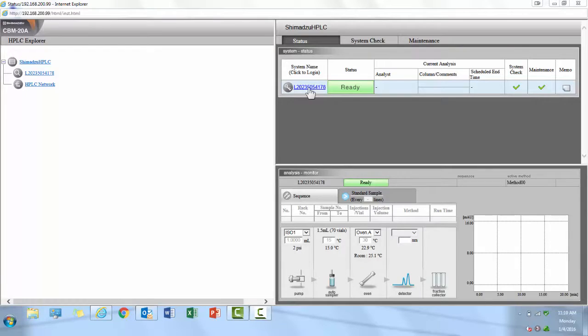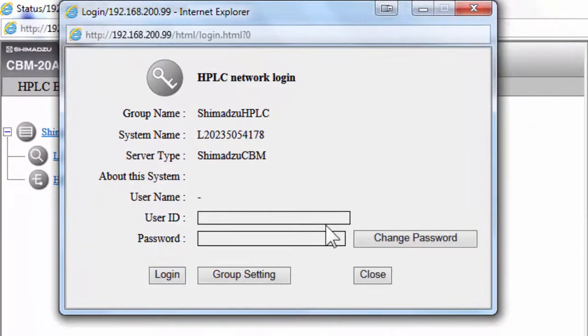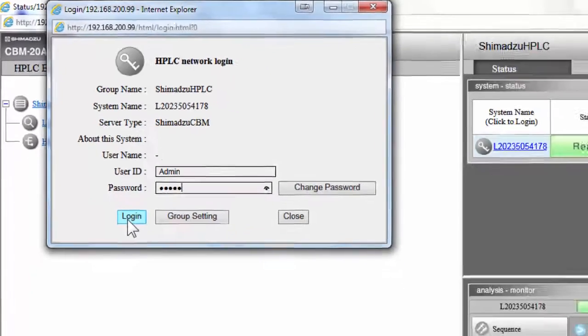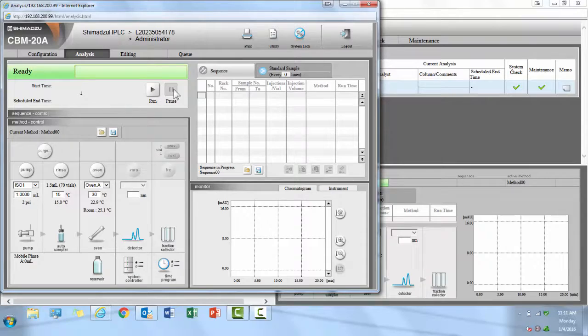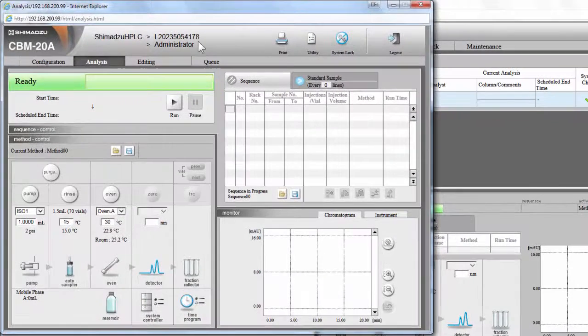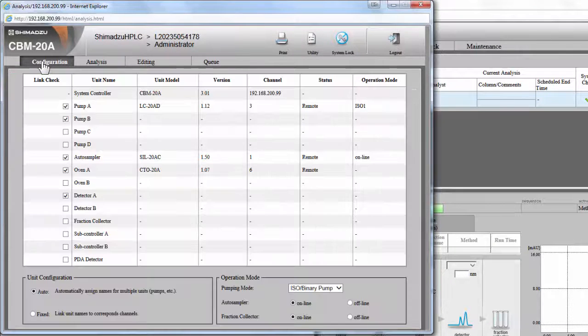To log in to control the hardware, select the Status tab, then click on the blue hyperlink under System Name. Again, both the user ID and password are ADMIN with a capital A. Be sure to click on Login, not Group Settings, to gain access to the hardware control. Once you are logged in, notice the four tabs across the top starting with Configuration on the left. In the Configuration tab, you will see which hardware modules are currently online with the CBM-20A, along with their current ROM versions, channel address or port address, and their status.